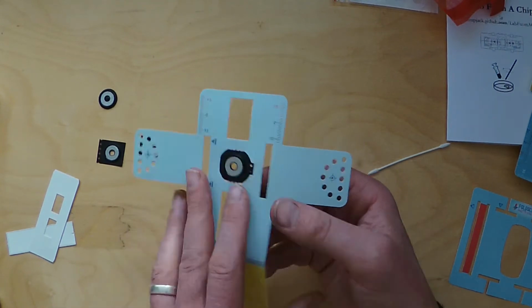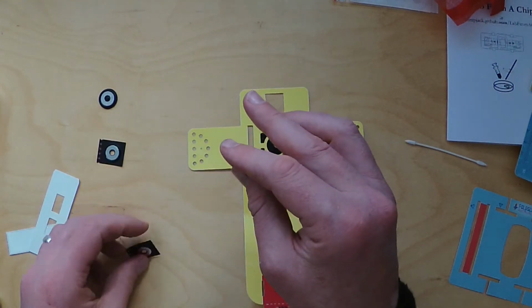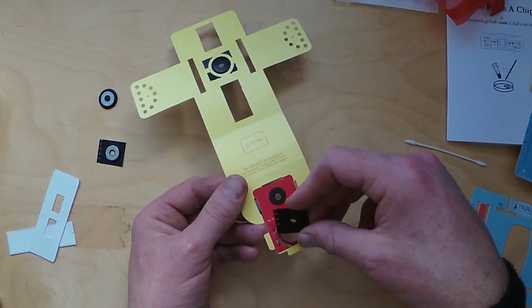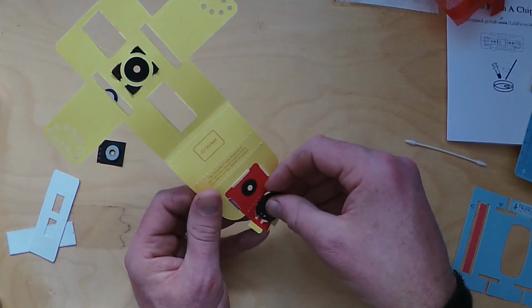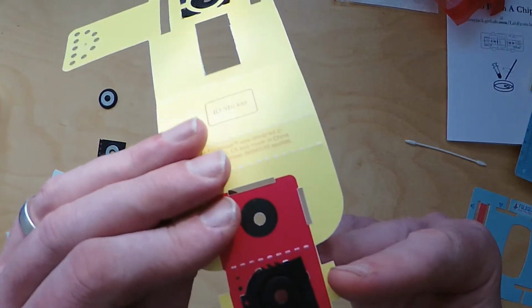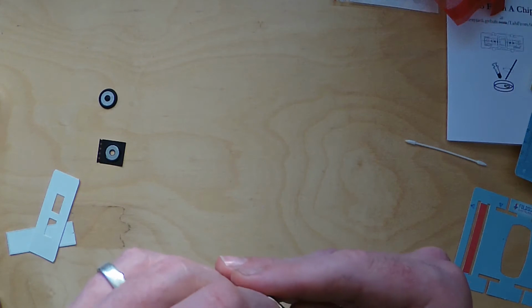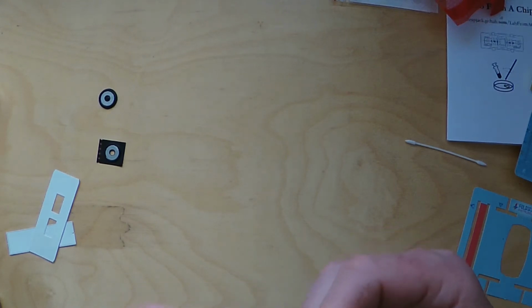The next thing you want to flip over. Now you've got the yellow and the red at the bottom. You want to take another coupler. This time the alignment perforated holes on the left. Okay, and you can see again those holes, there's some markings that indicate you put those holes there. And once again, you want to slide that in like you did before. Tuck them into those holes, and again do a little bit of bending to tuck those corners in. There we go.